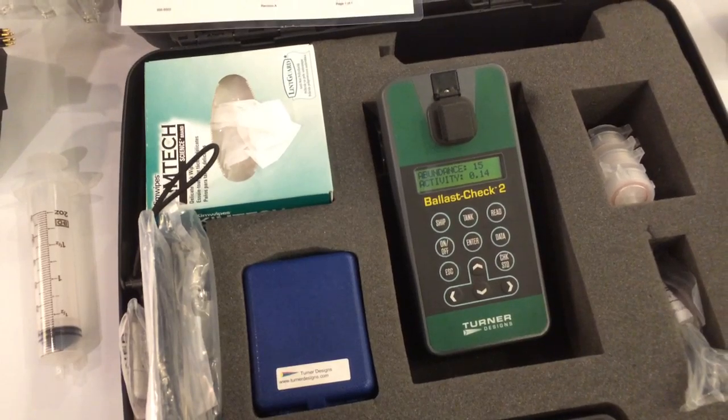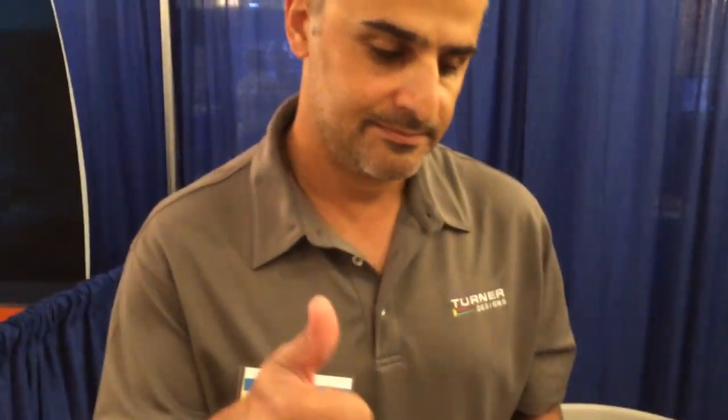It's a quick and dirty method. Alright, thanks so much. Turner Designs, Ballast Water Detection — pretty cool.